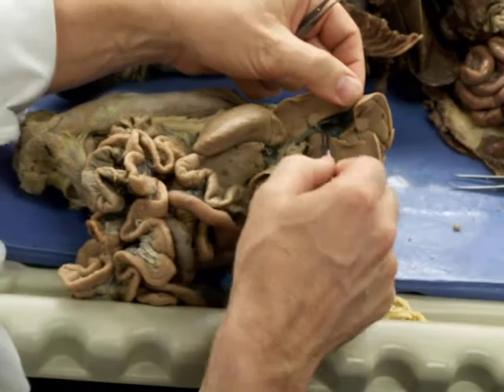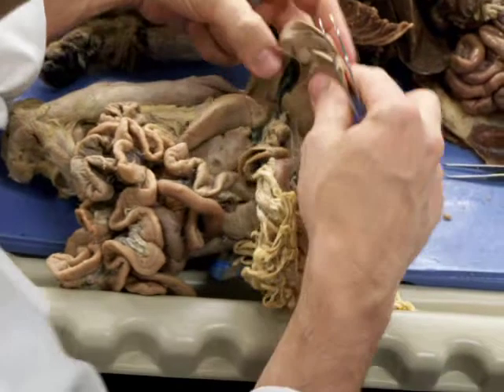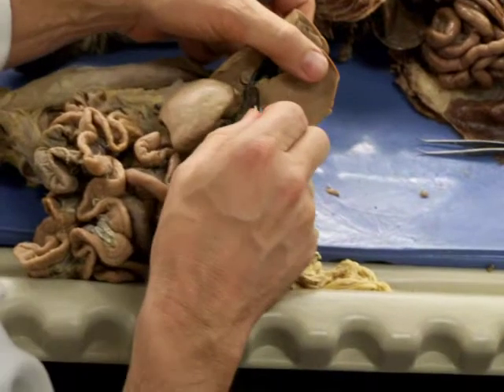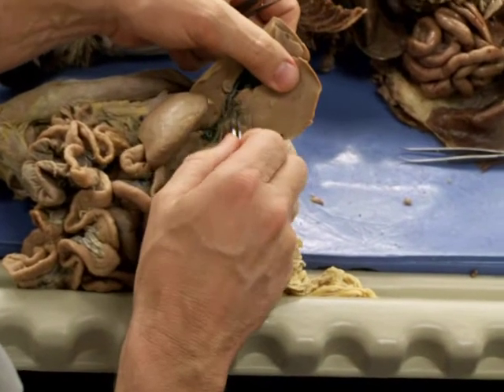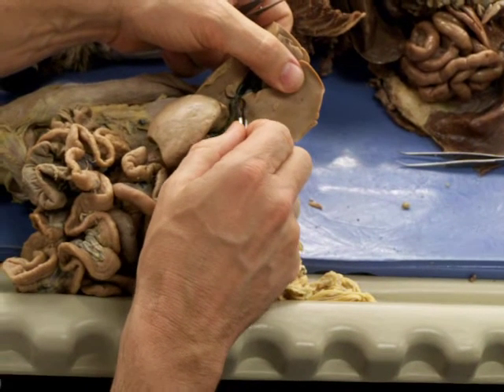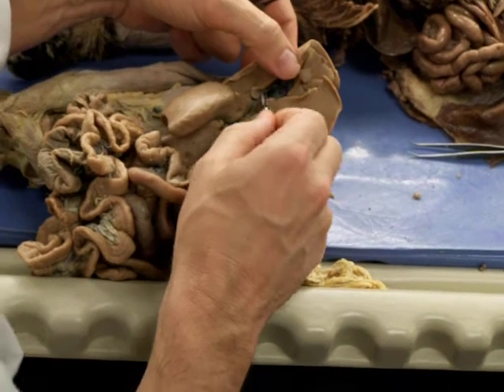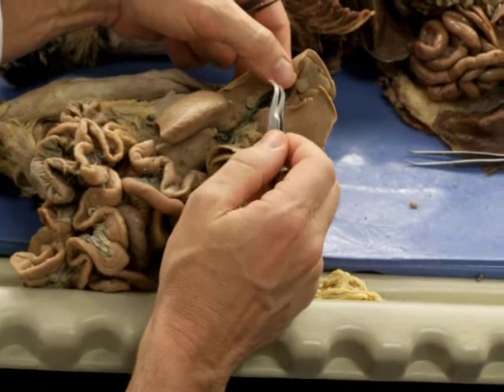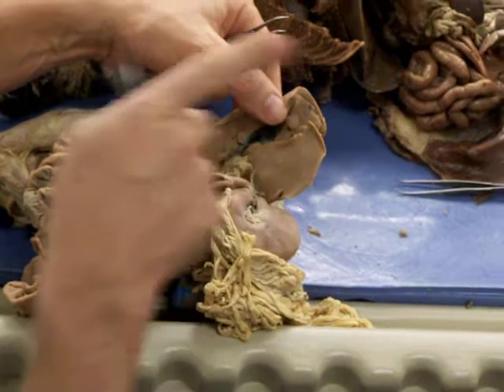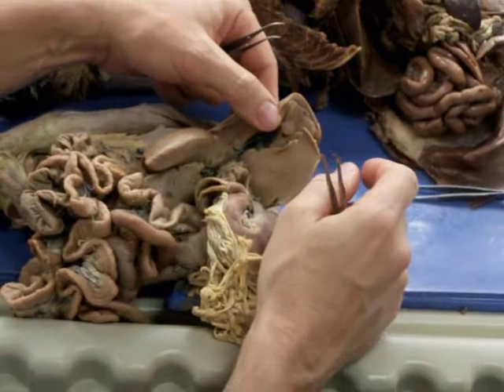You can see it coming from the gallbladder. And some people were asking yesterday about the different ducts. The gallbladder connects to that common bile duct through a cystic duct, which is kind of like the neck of the gallbladder. And then if we were to dissect into the liver from here and go up into those lobes, you'd see that there are hepatic ducts going to each of the lobes of the liver.